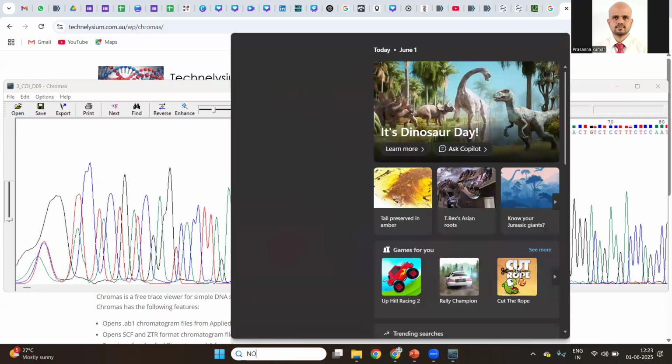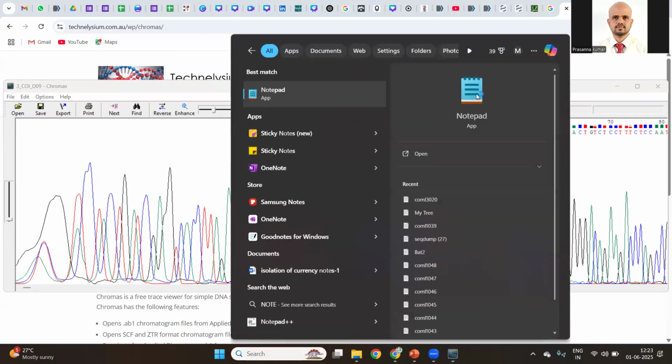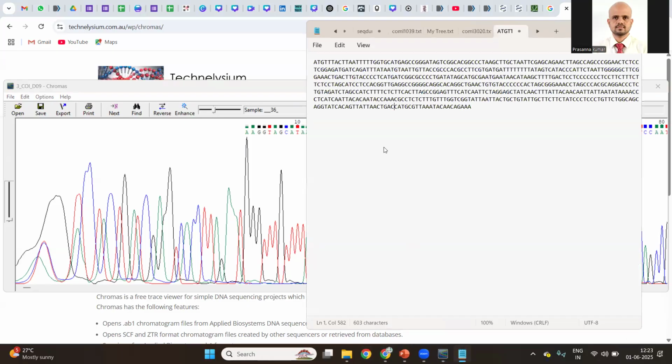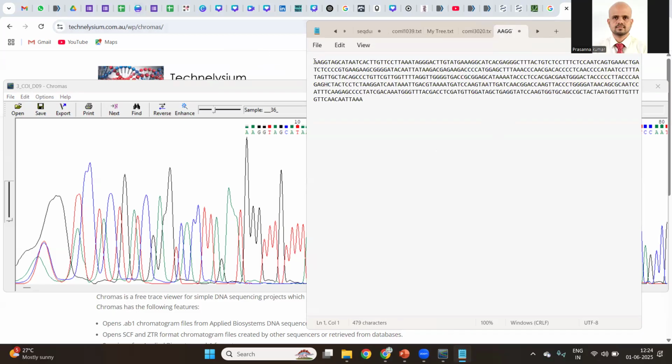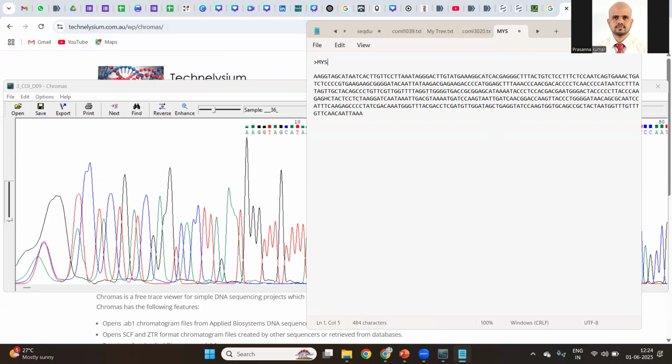Open a plain Notepad file and paste the sequence. Maybe I will name it as my sequence. This is a FASTA file format, right? Whenever you place a greater-than symbol, whatever you write after that is considered English text. The hard enter will tell the software that what follows is a nucleotide sequence. So below this, you paste the sequences. You are going to take them from your BLAST analysis, find the species, take the reference sequences, go for the phylogenetic tree, and then the pairwise Excel sheet data.